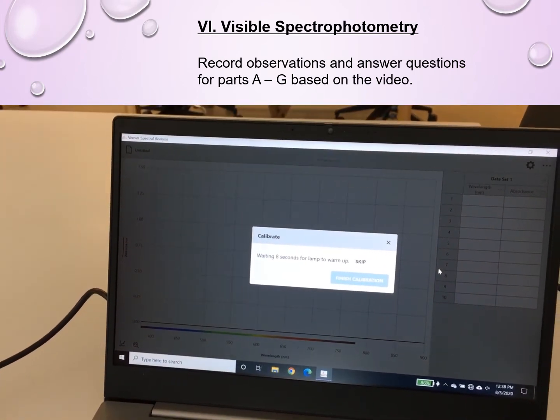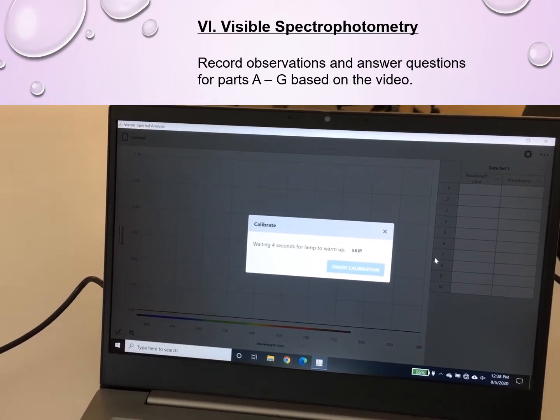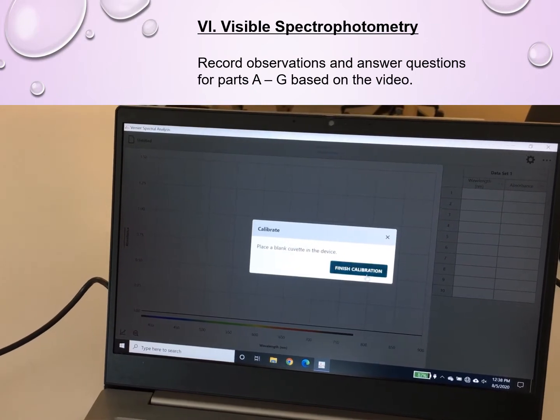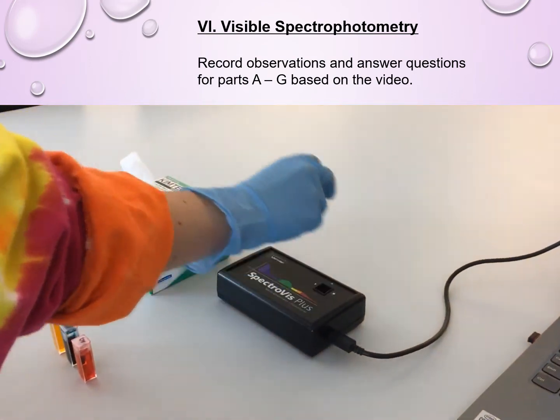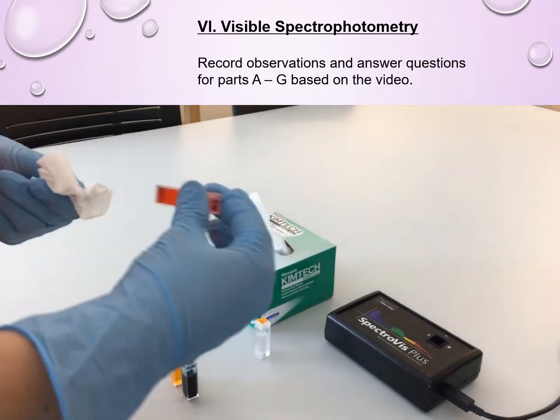So once she started the process, you can see that the lamp has to warm up, so there's a little bit of a wait, and then the device will just be zeroed out essentially, 0, 0. So now we can begin to actually measure absorbance of our samples.